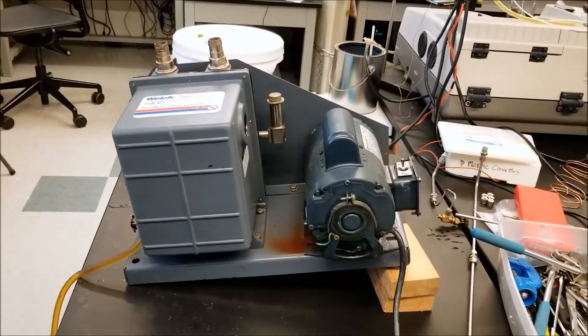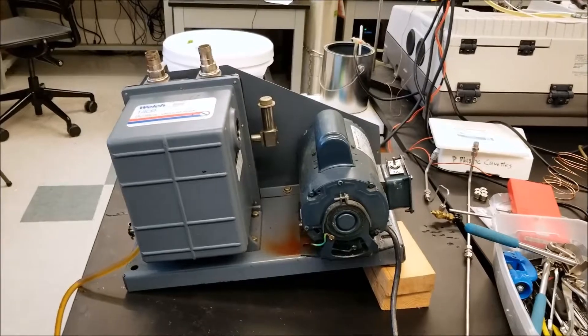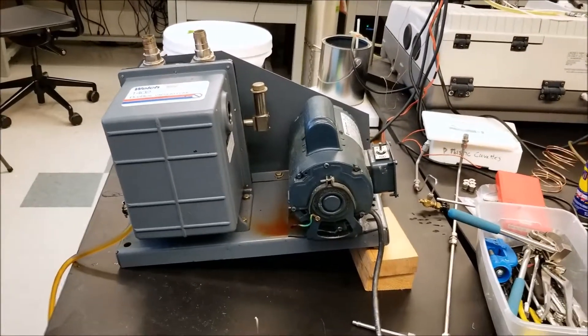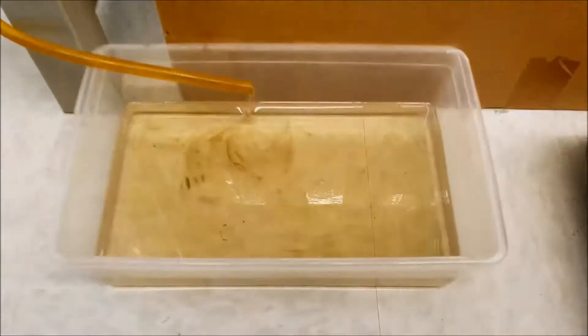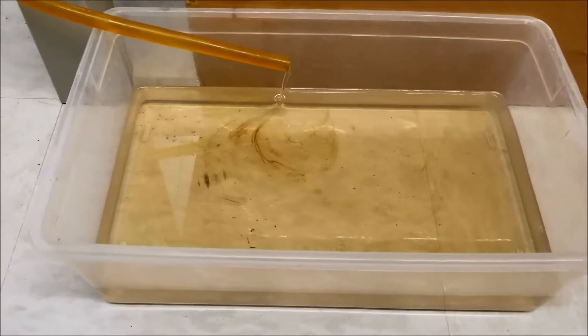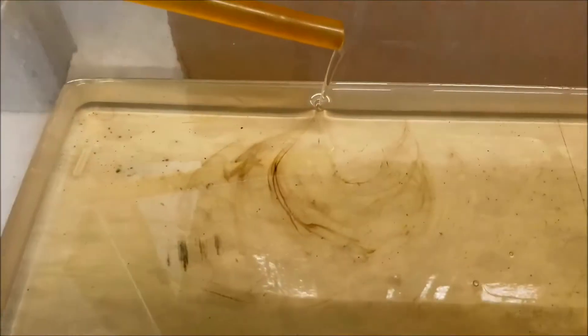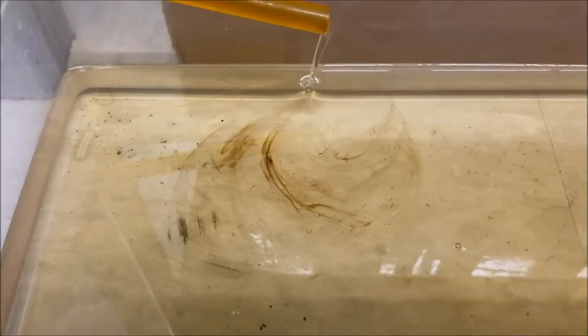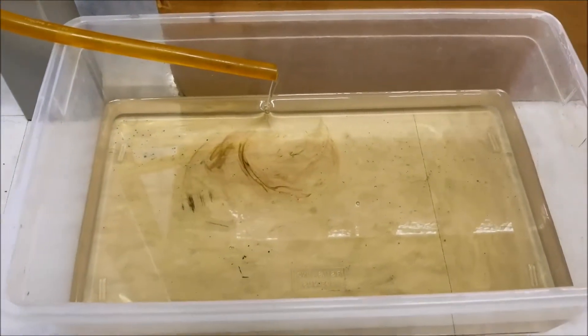So every July and every January I will shut the system down to change the oil of the pump. I already have this going here and you can see the oil coming out of the pump. It's got a slight gray hue to it. In fact, we see black spots coming out with the latter parts of the oil. This is just dirty parts of the pump internally.